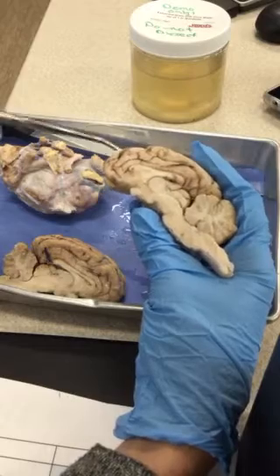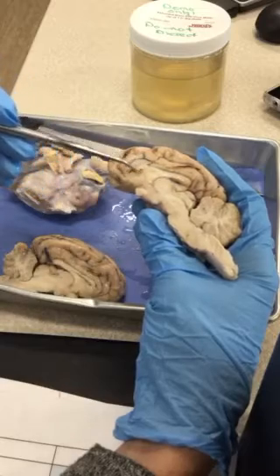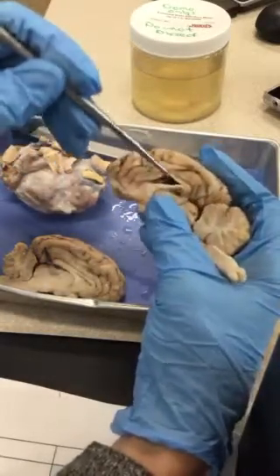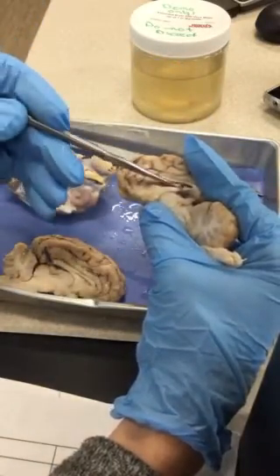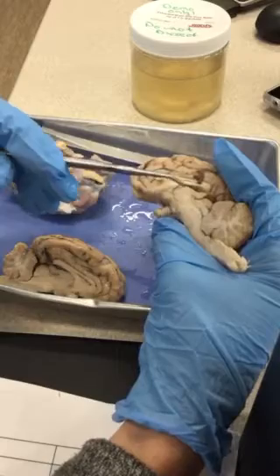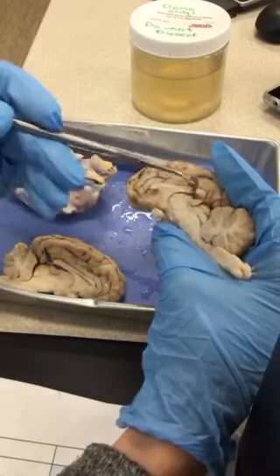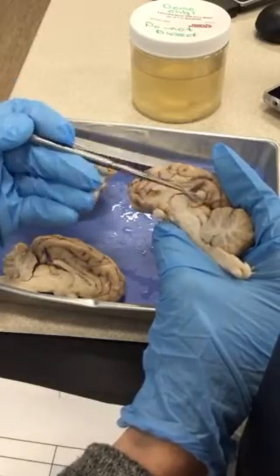So let's look at structures in a sagittal view. This lighter structure here looks like a flattened C shape. What do we say that was called? Corpus callosum, yep. And if you put your probe in there, see how there's a space that I can actually separate it? And if you dig down in there, there's this brown tissue that we find there, and we'll also find some in our third ventricle. See the round thalamus here? So there's the third ventricle, and there's some more of this choroid plexus. Remember that brown tissue I said you would find there? So here's choroid plexus, and here's choroid plexus.